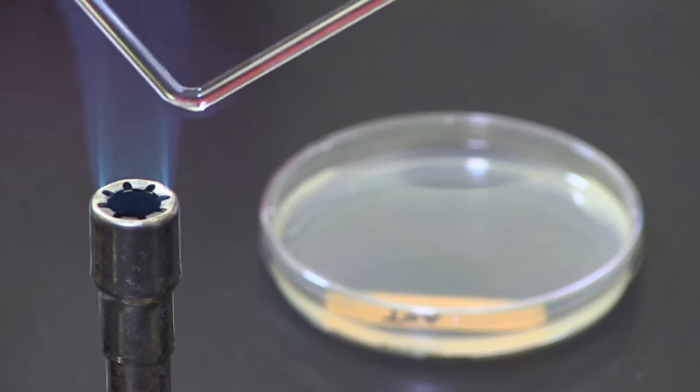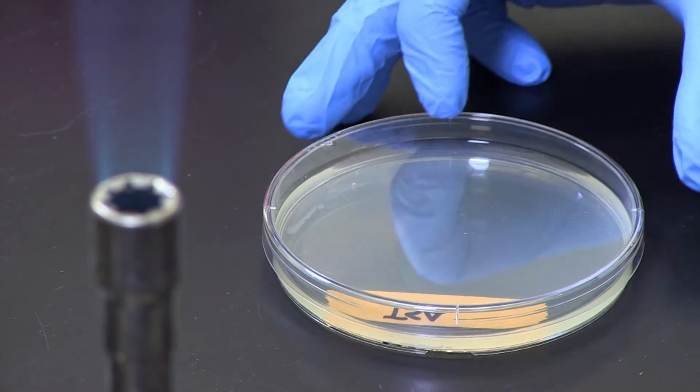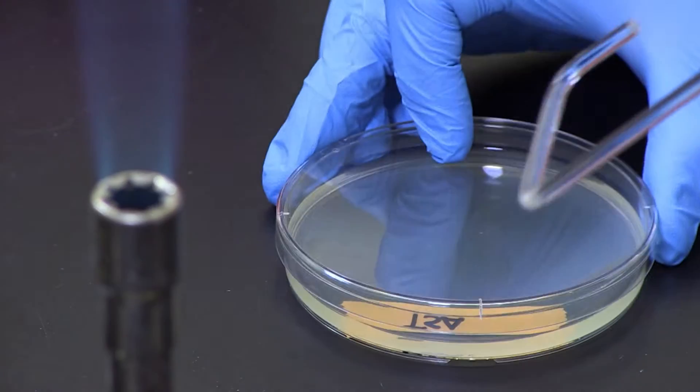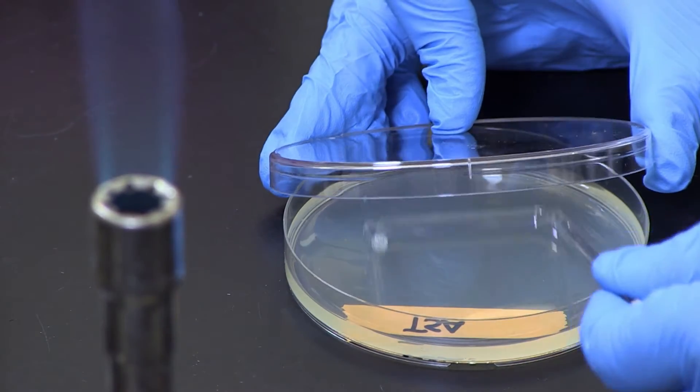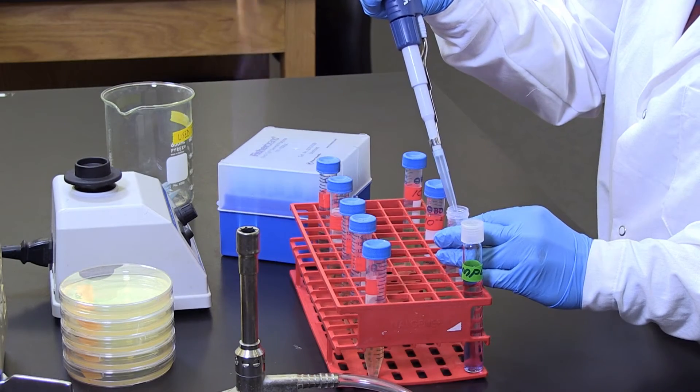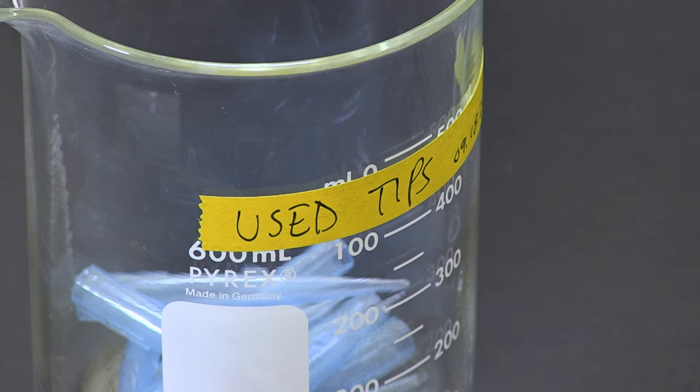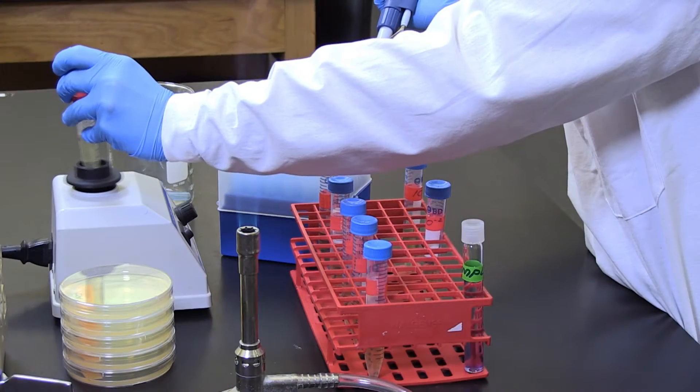Once you begin, remember to always work close to the flame. The hot air generated from the flame helps to reduce airborne contaminants. Also remember to change your pipette tips every time you transfer a solution from a higher to a lower concentration, and mix each solution well before starting a new dilution.